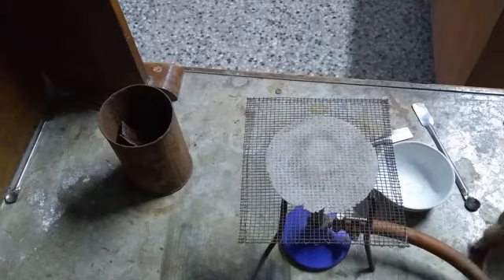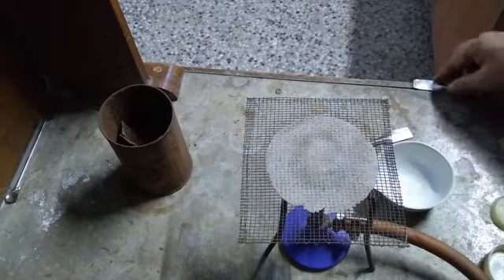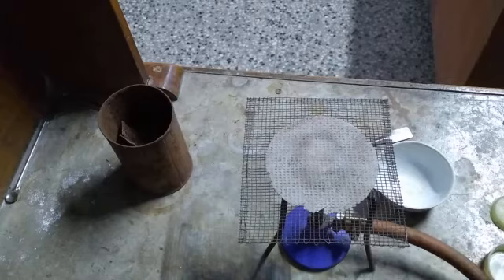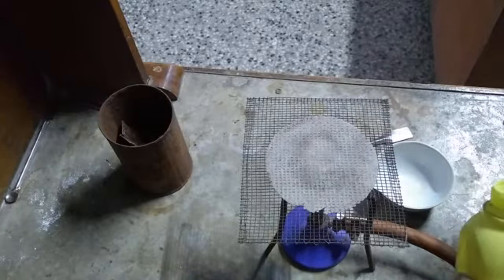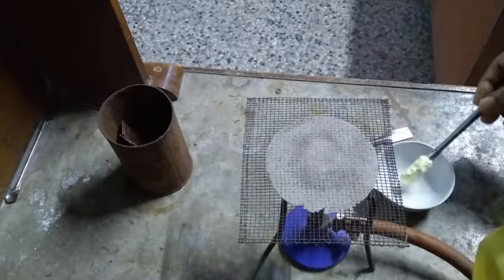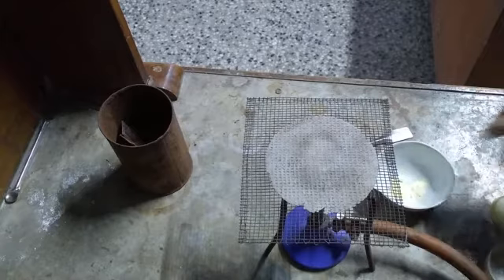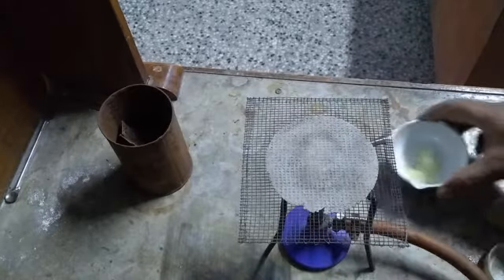Now I am taking sulfur. Sulfur is of yellow color — just I am taking a little amount of sulfur here. See the sulfur — it has a light yellow color. Here I am keeping it.